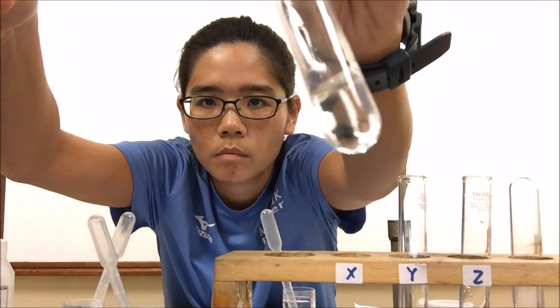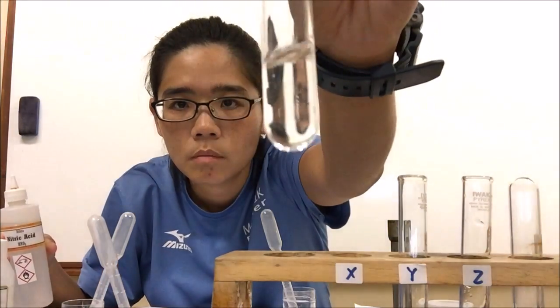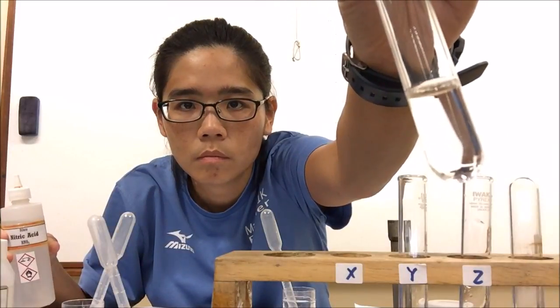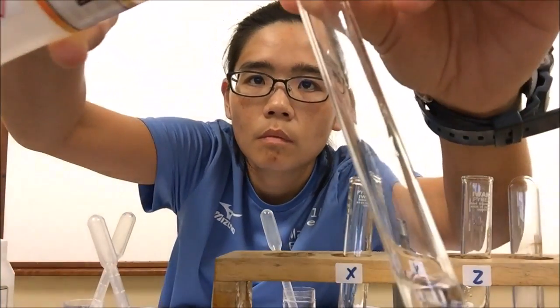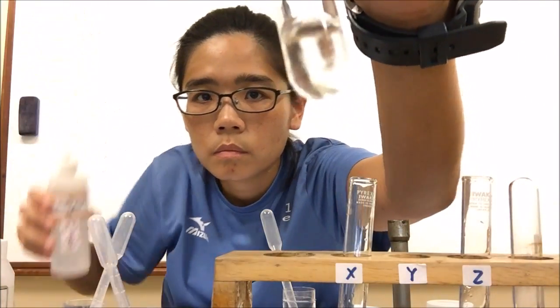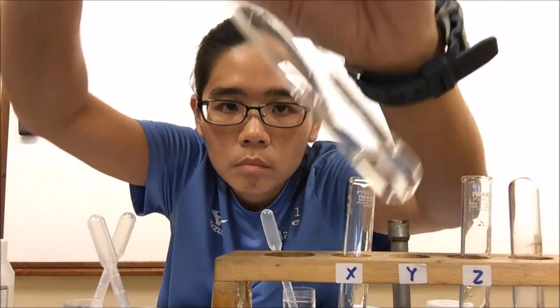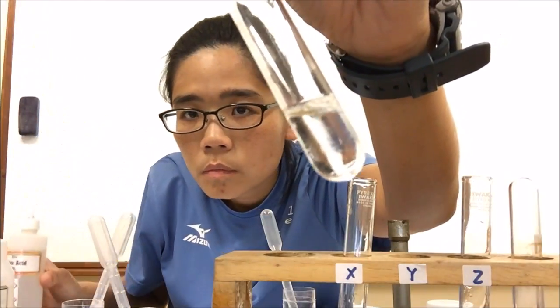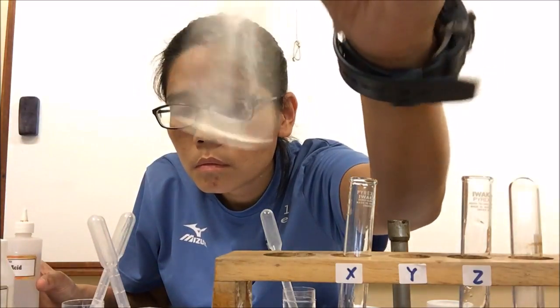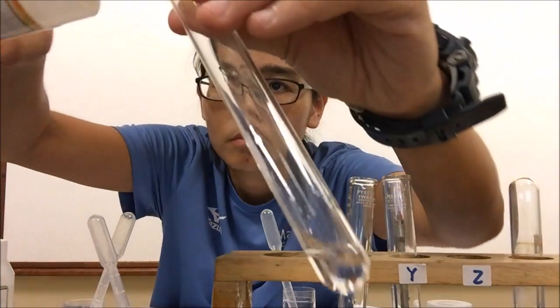For solution Y, I add nitric acid, and I do notice a change — there are tiny bubbles formed upon adding nitric acid. Where there are bubbles, that means a gas is being produced. I shall come back to test for the identity of the gas. I add nitric acid to solution Z as well, and upon shaking and mixing, I also see bubbles. So I need to decide on the test for the gas.